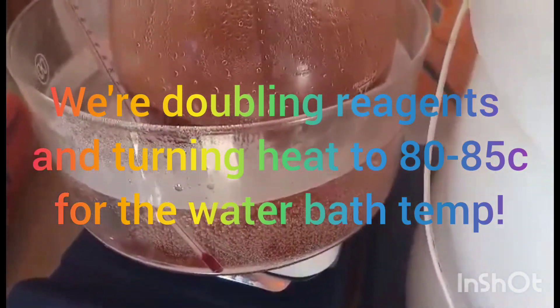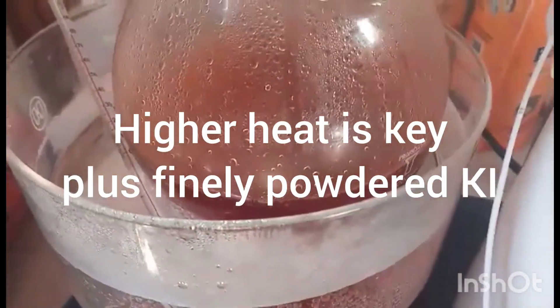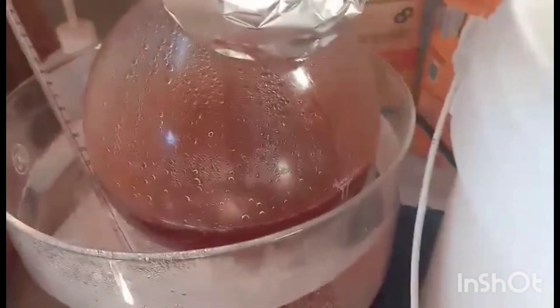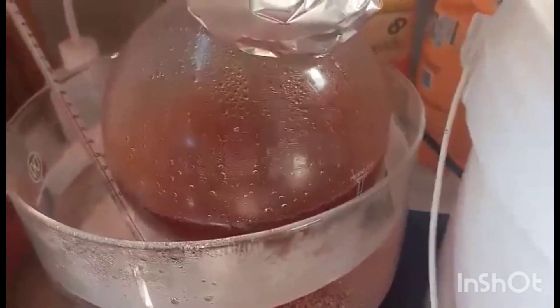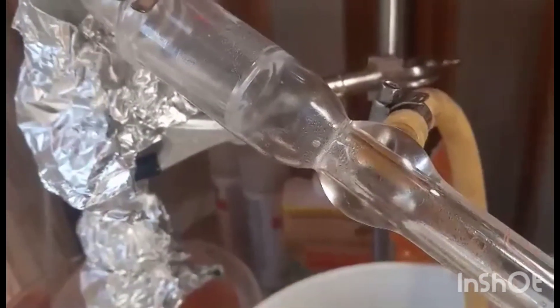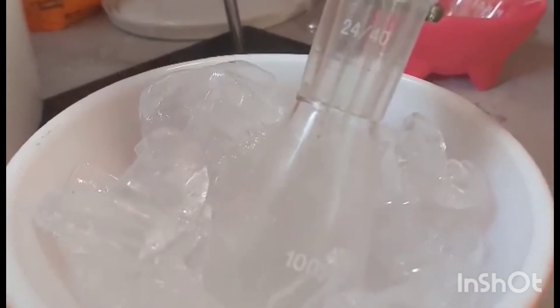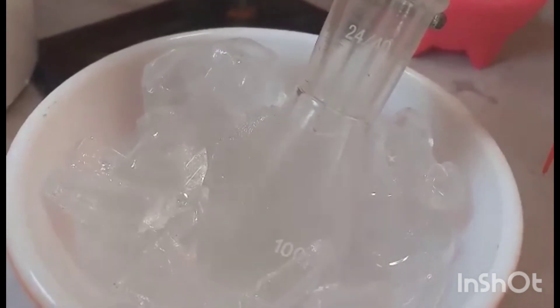Alright guys, round two. I've doubled the starting materials: 350 mils of 85% H3PO4, about 132.44 grams of potassium iodide, and 240 mils of methanol added. We're getting a lot of condensation. The thermometer reads 33.7°C — a little low — but this batch and the last batch are going to be redistilled together. Much better dripping than last time.